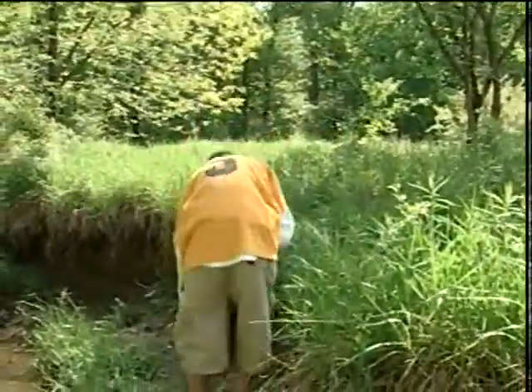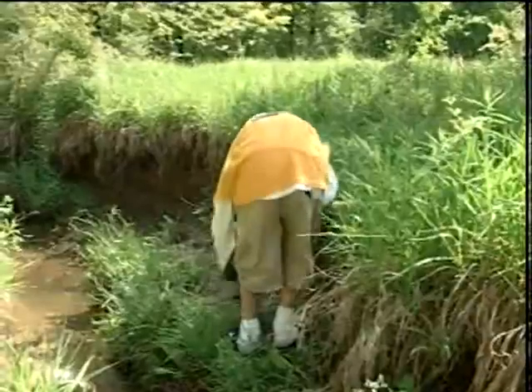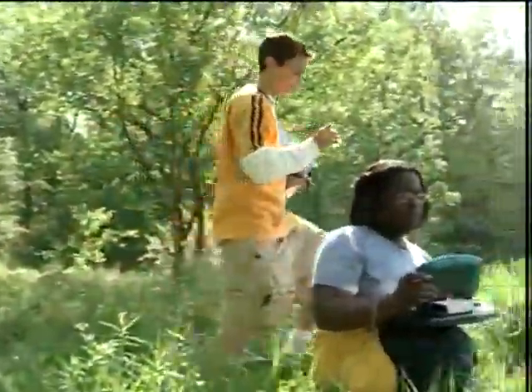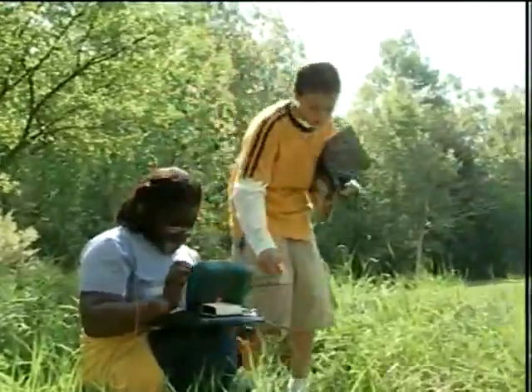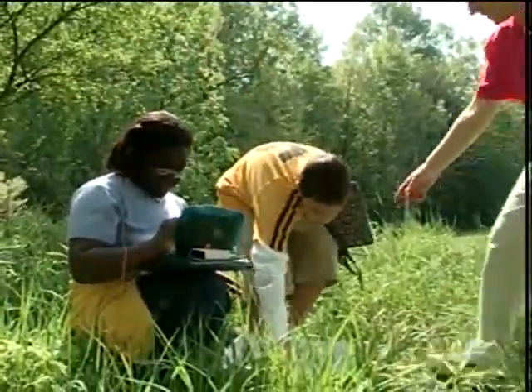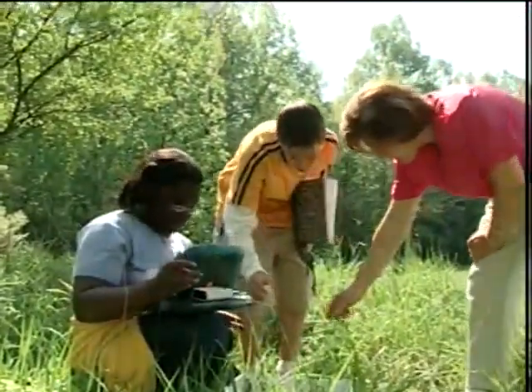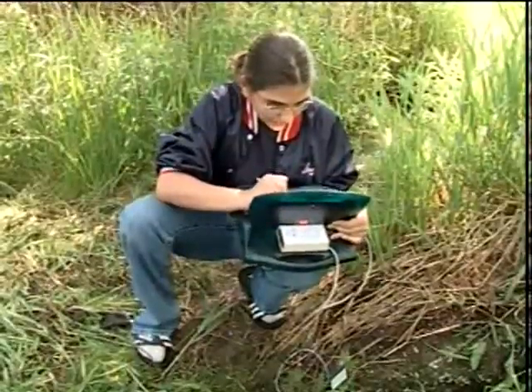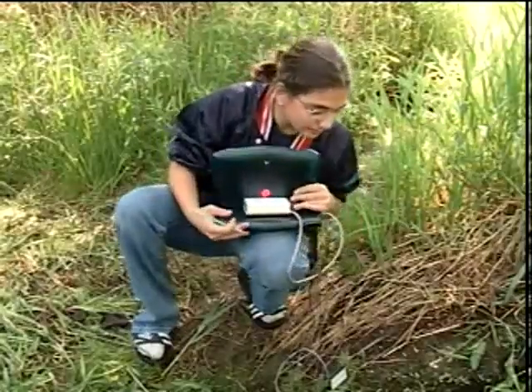Is there anything as far as new pictures go that you'd want to take today? Or is everything just about the same? It's just about the same, book-wise. Okay, great. So are you done with pH? Yeah. Okay, so why don't we get the probe back in there? 13.99.